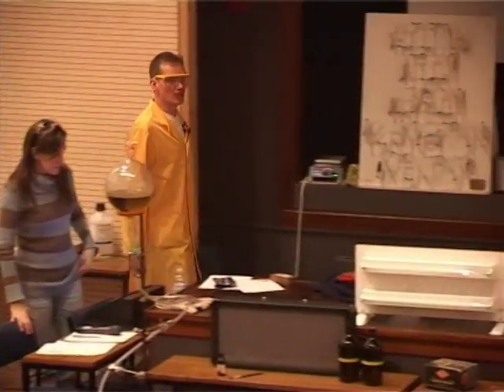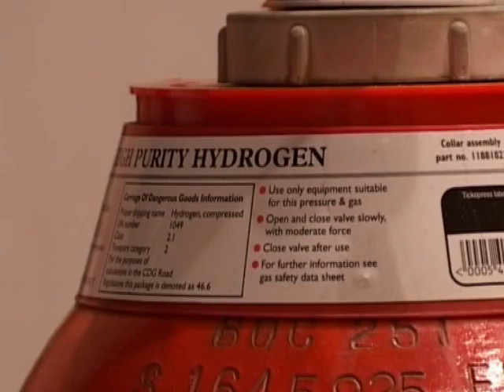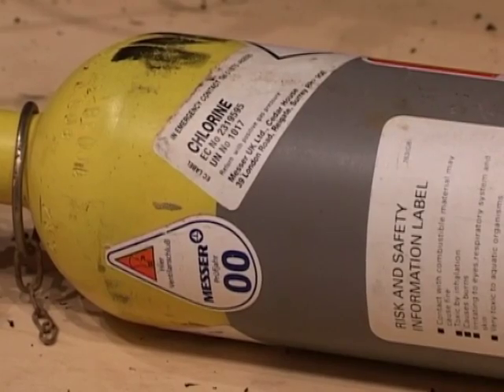We've got some tubes containing two gases mixed up. We have the gases hydrogen and chlorine.